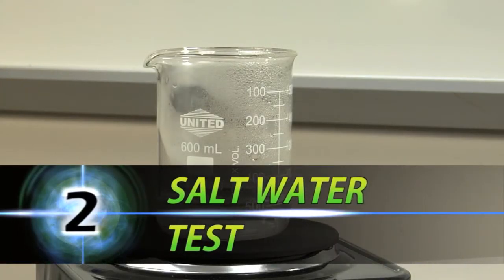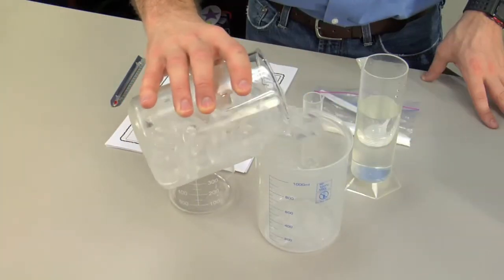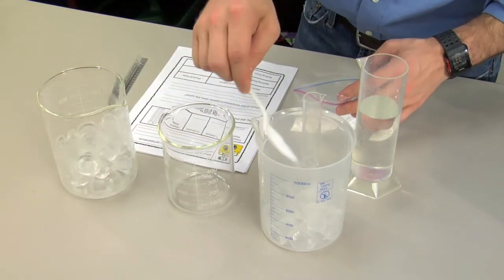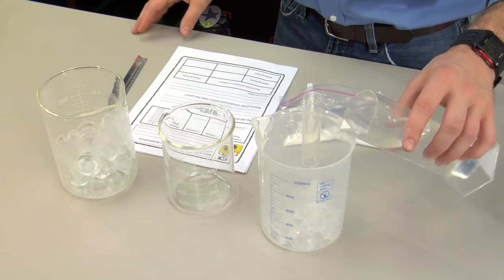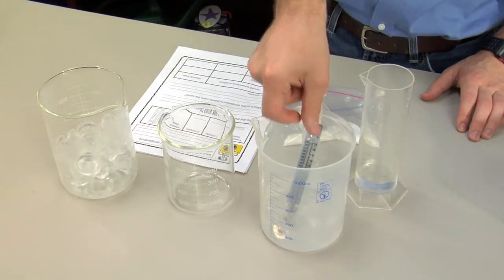Now for the salt water test. Pour at least 8 ice cubes into a beaker and pour salt over the ice. Add water. Mix and record the temperature after 2 minutes.